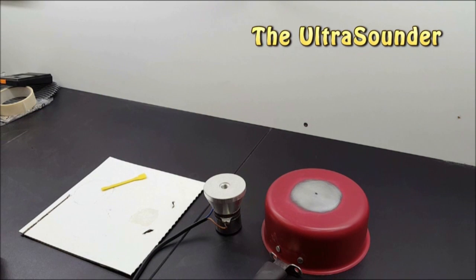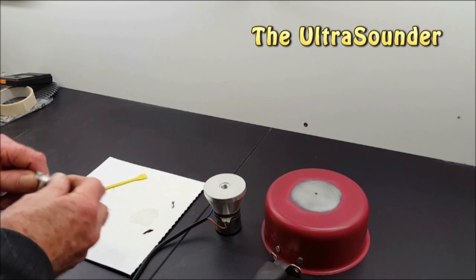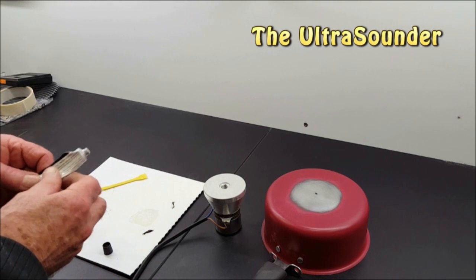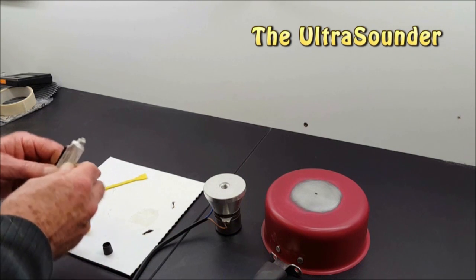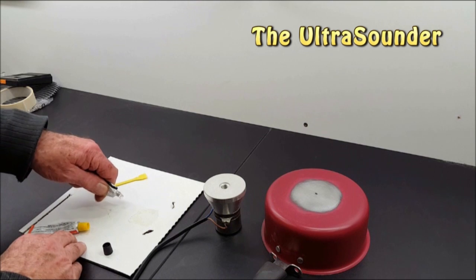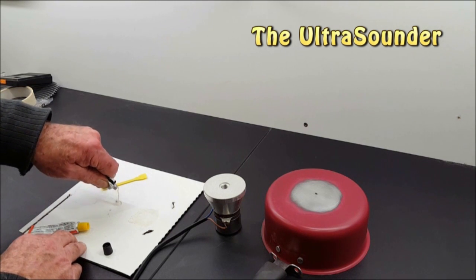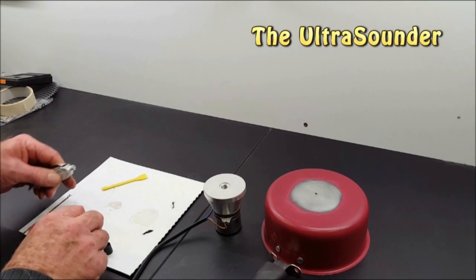Hello there, recently we needed a new ultrasonic cleaning machine for our experiments and I had a look on the web and they're very expensive indeed. So we decided we were finding components and put the machine together ourselves, which is probably good because I can build one exactly as we like.